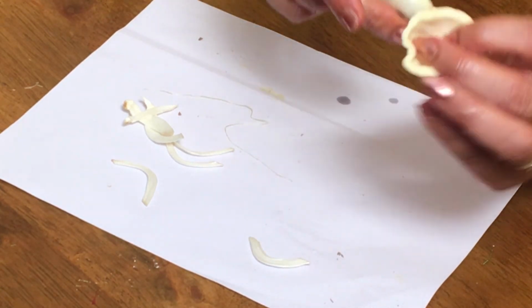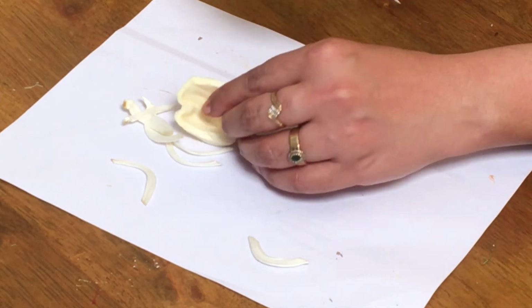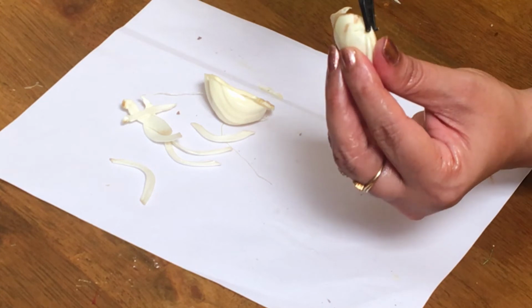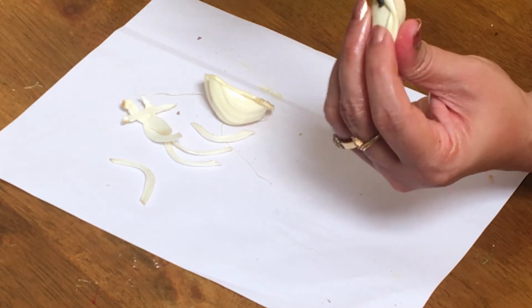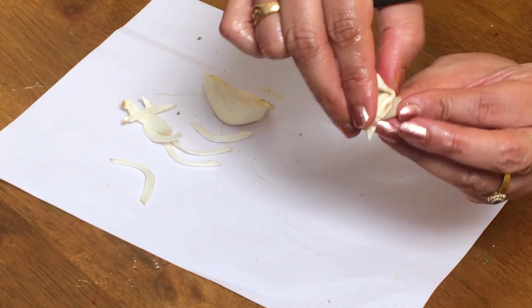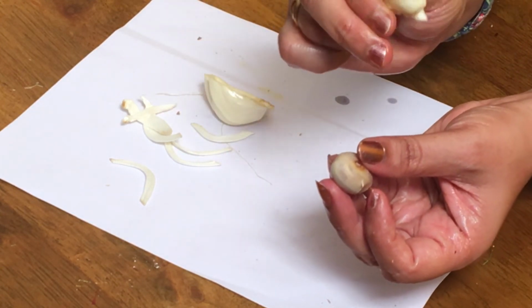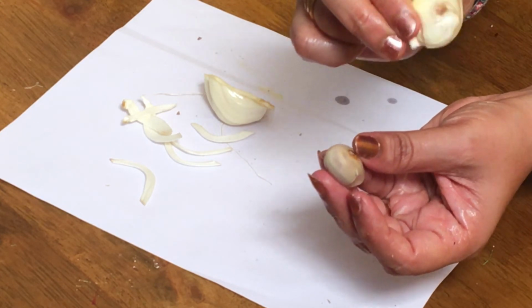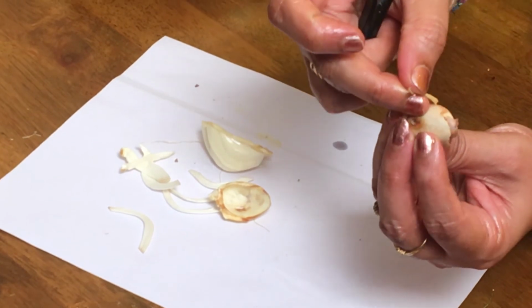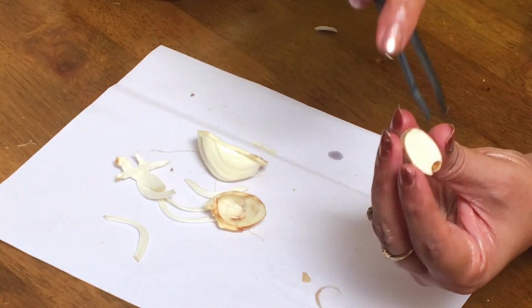This is the perianth. So this is the edible part, which is a fusion of both sepals and petals. Which is a fruit? The wall of the ovary is this leathery skin. This is also non-edible, we don't eat it. So this is the wall of the ovary. It is not fleshy, it is just thin and leathery. And inside that you will be able to find the seed. This is the seed coat, and once you open the seed coat, you will be able to find the seed.